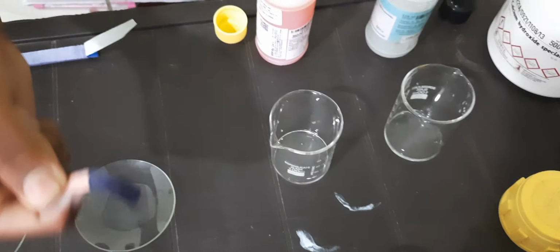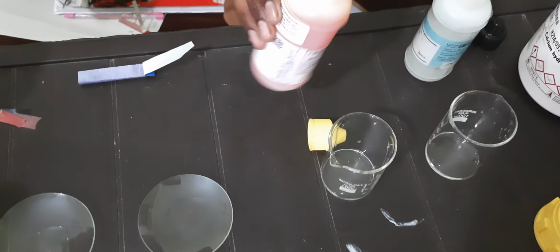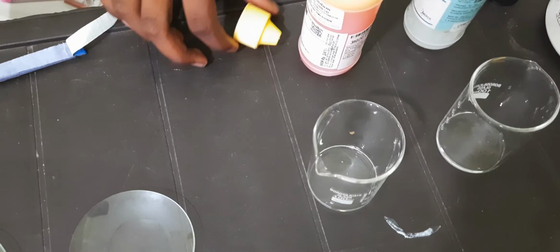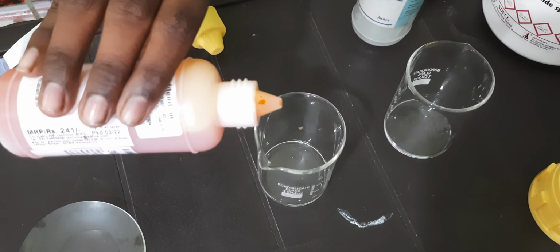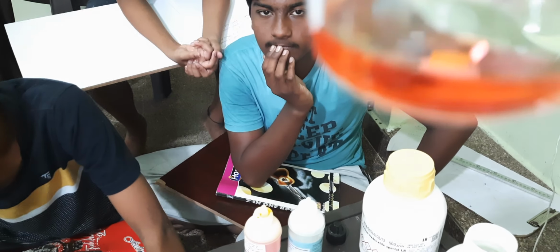Okay, next phenolphthalein. You put 1 drop of phenolphthalein in this acid and observe carefully. Okay, 1 or 2 drops. Methyl orange, 1 or 2 drops. Then observe the color. What is that? Okay, leave it. Now observe carefully. The methyl orange changed the acid to red. What is this color? Red color. Red or pink? We can consider this as red.